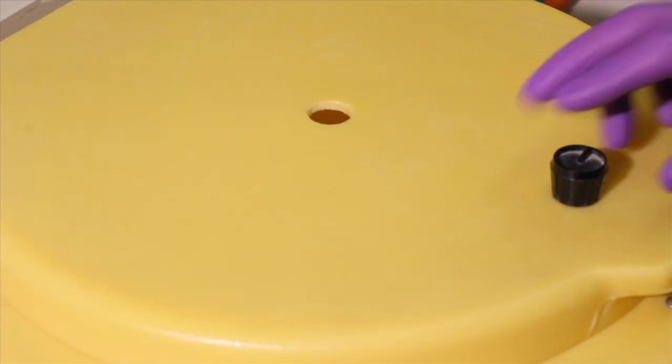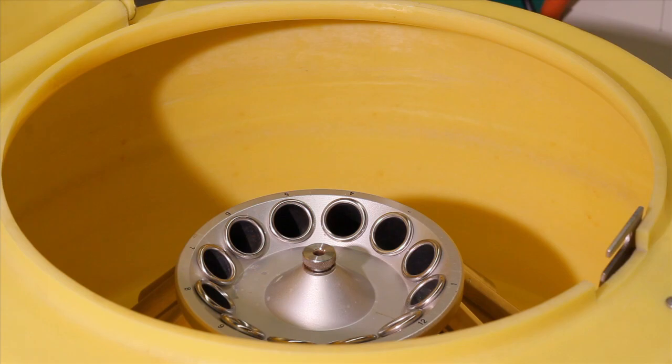Before use, check the inside of the centrifuge to ensure it is free of debris.